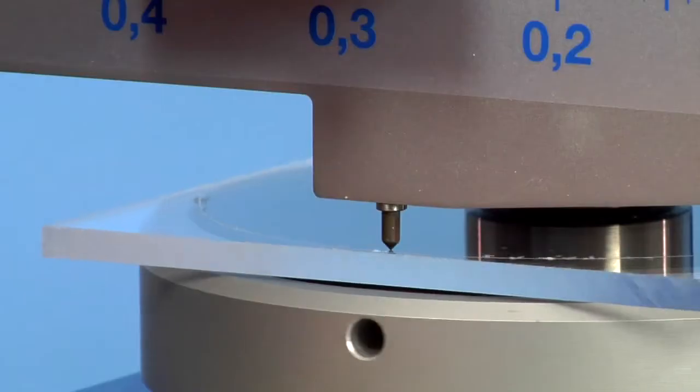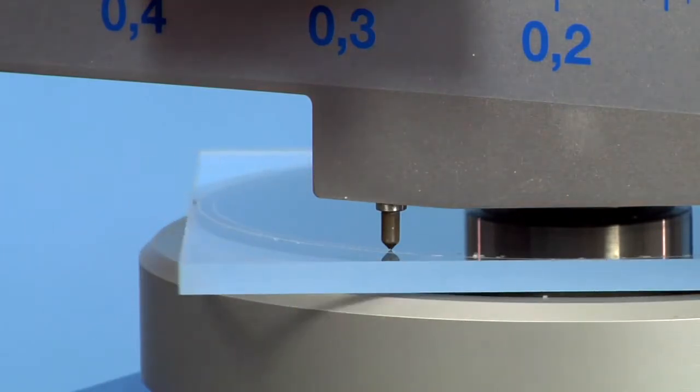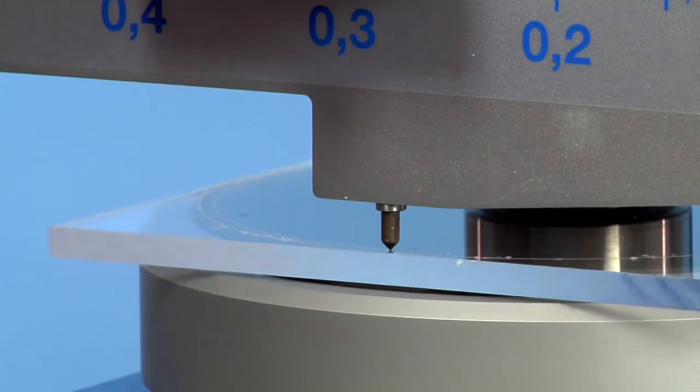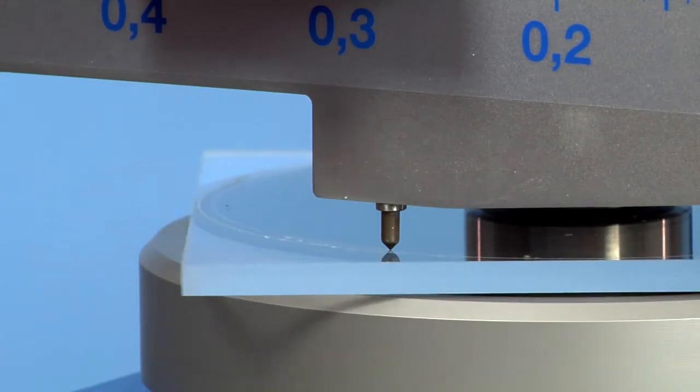The second test with reduced radius and weight force, and so on until there's no longer any trace visible.